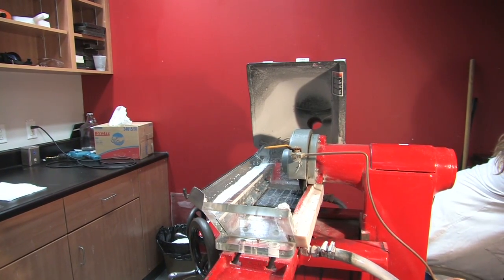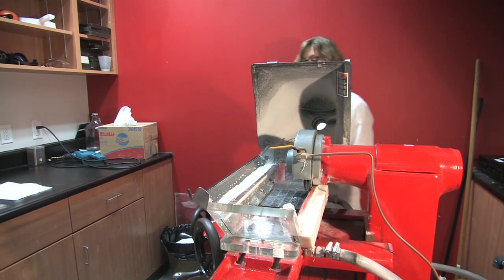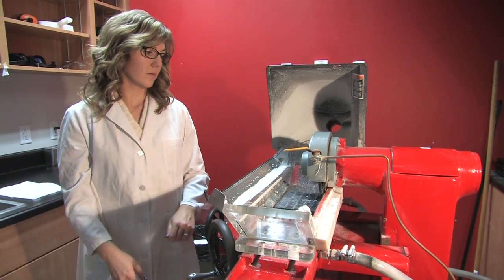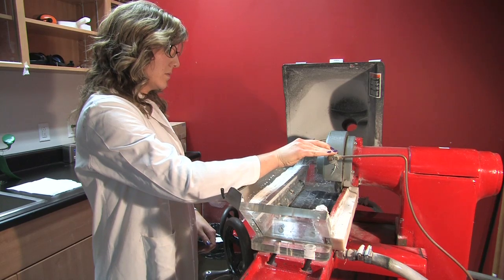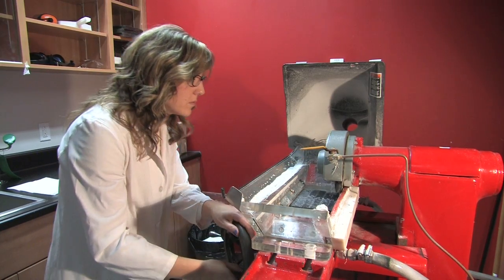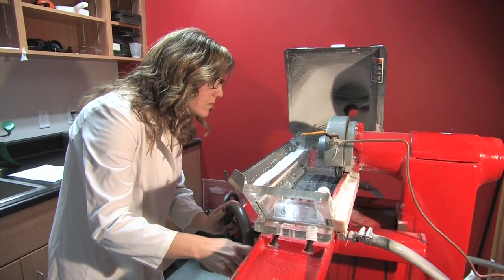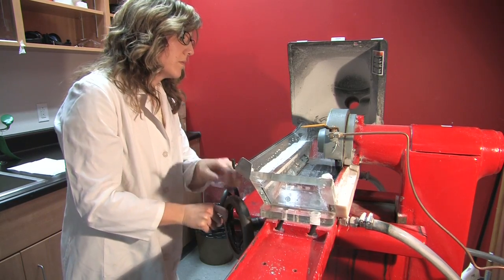Then turn on the power. You're ready to make your first cut. Turn the horizontal control wheel slowly and steadily until the entire length of the plate is cut.